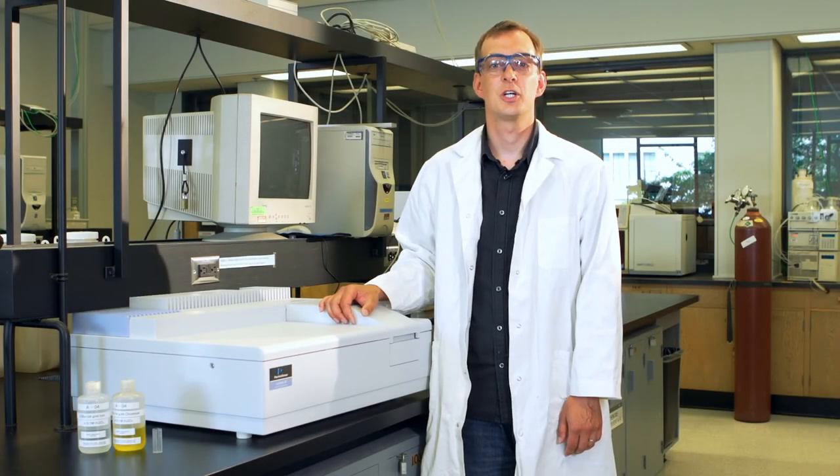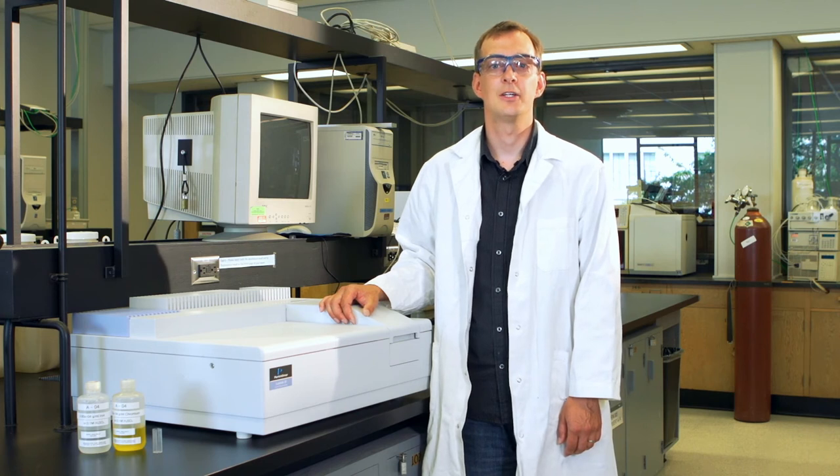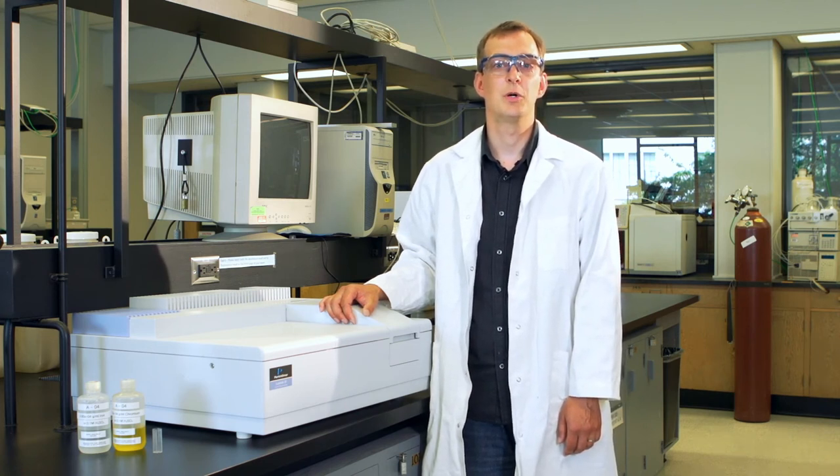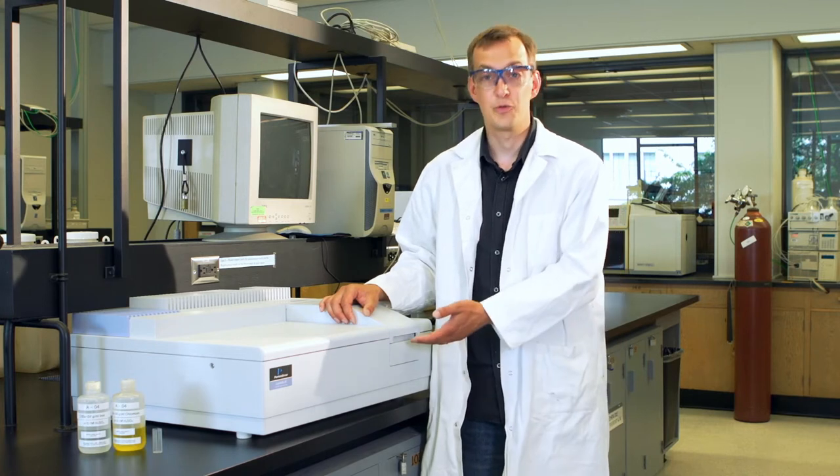Hello and welcome to the series of instructional videos for the third year analytical chemistry labs. I'm Dr. Robin Studley and this video will be about the instrumental setup for spectrophotometry.